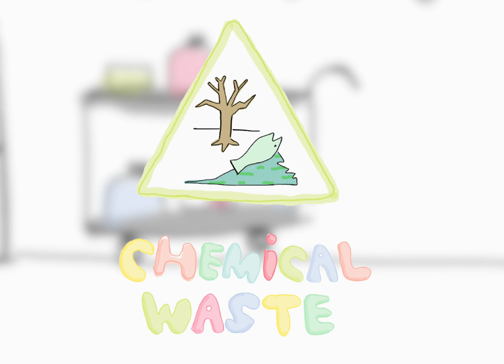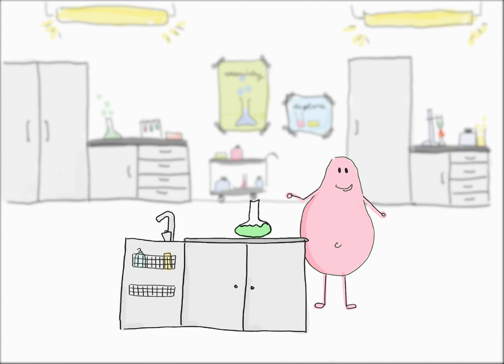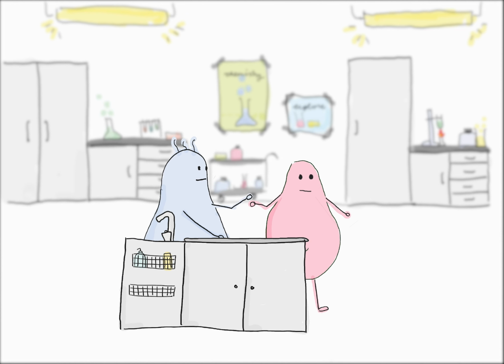All chemicals produced while experimenting have to be disposed as special waste. I always think about simply pouring the chemicals into the sink. This would be much easier. But my teacher is so strict about this rule.